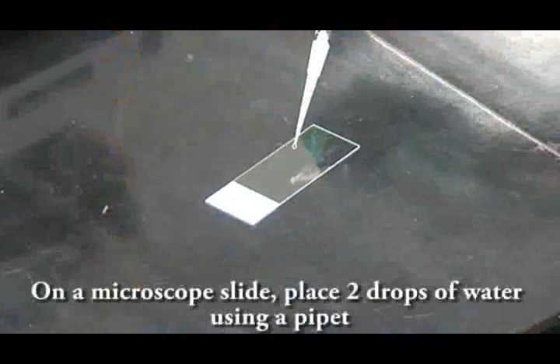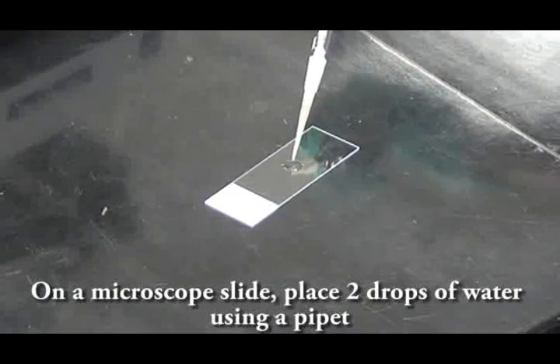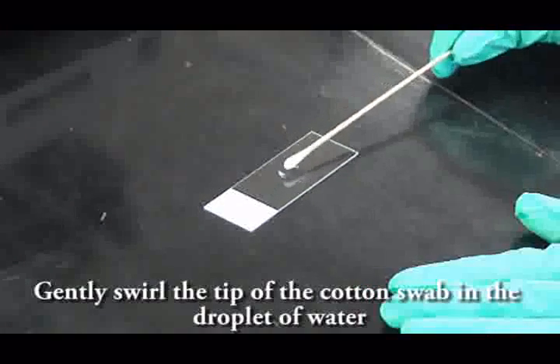Re-enter the lab, place a couple drops of water onto the microscope slide, and swirl the tip of the swab in the slide.